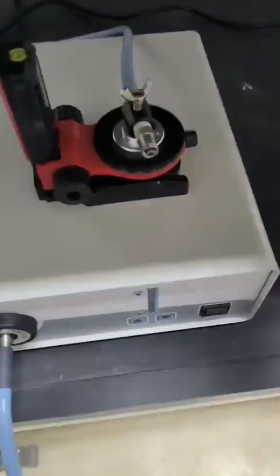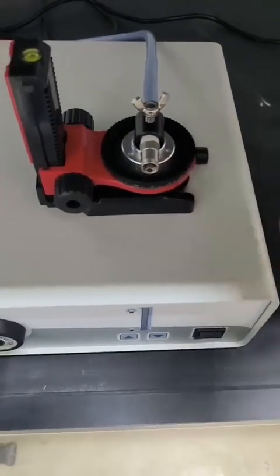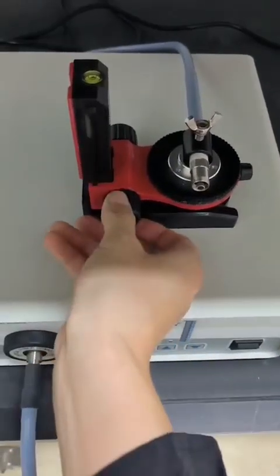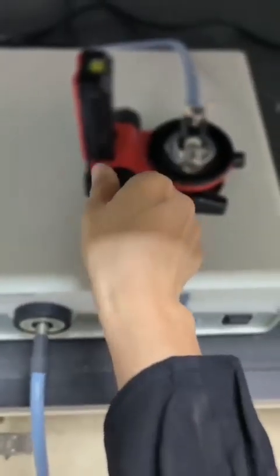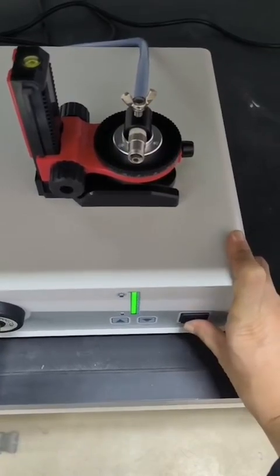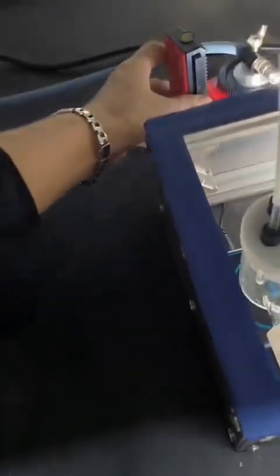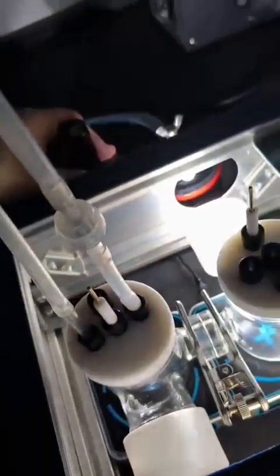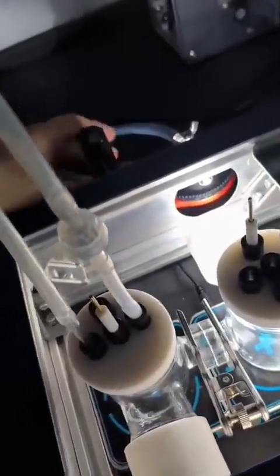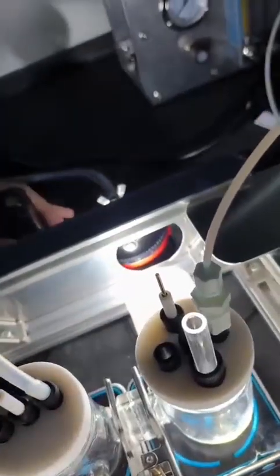Then use this one to adjust the angle to face your optical window. Then use this one to control the optical head. When everything is ready, you turn the light on to let it go. Then you can locate it to your reactor. Keep the fiber free to follow its natural texture. Don't make a dead angle in the fiber.